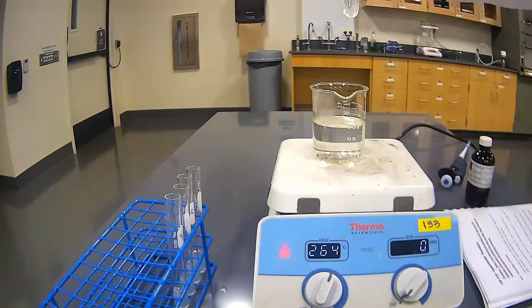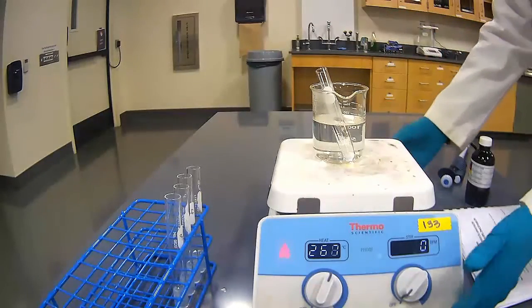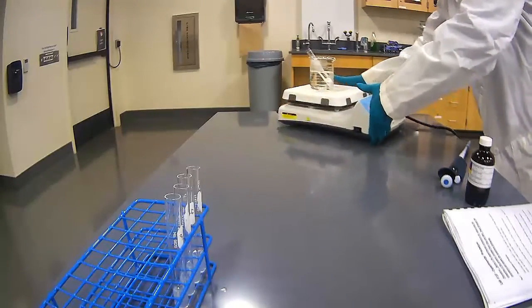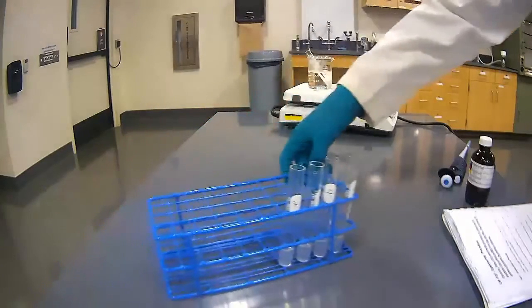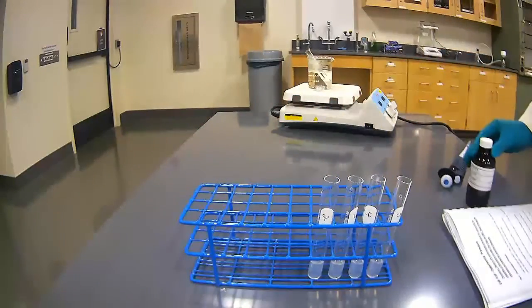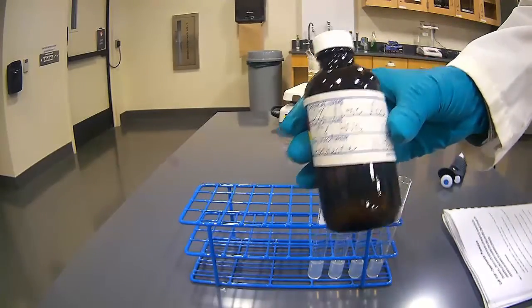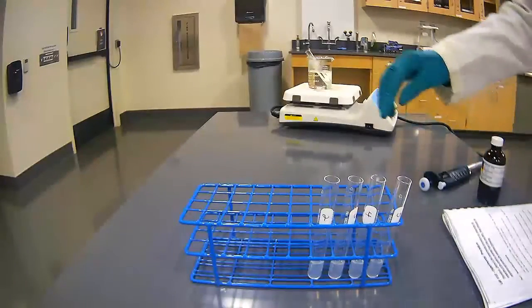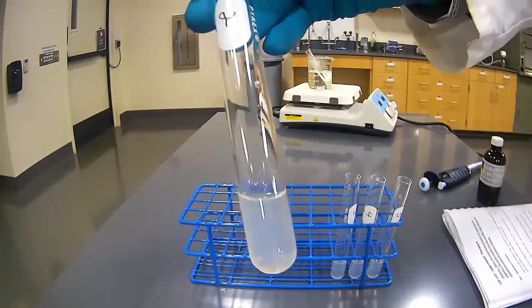So this is test tube 1. It's going into boiling water on my hot plate. We'll let it sit there as we test our other test tubes with different environments. Into test tube number 2, we are going to be putting nitric acid. So here's a 10% nitric acid solution, and we will be putting 2 milliliters into the test tube. So again, here's our observation of test tube number 2, our before.